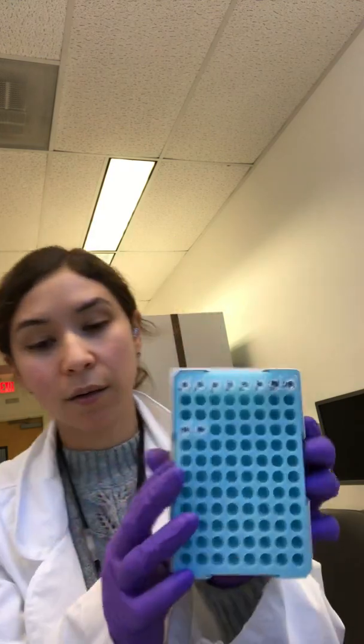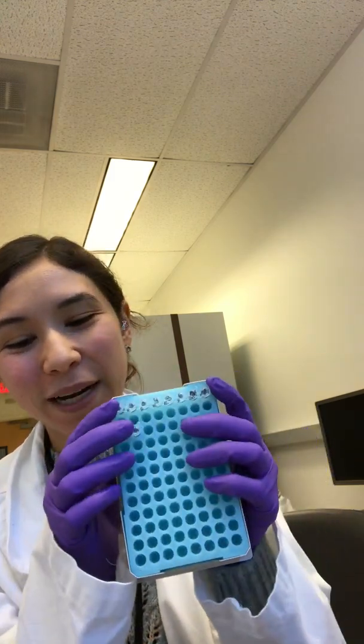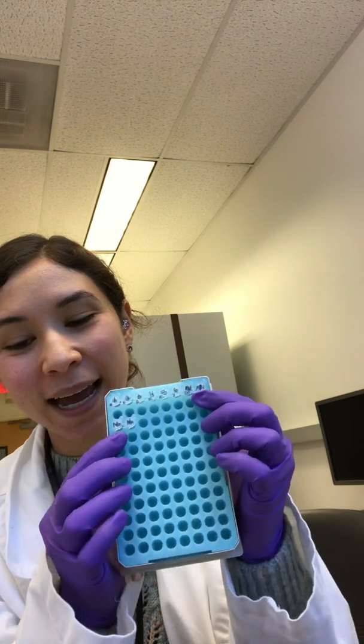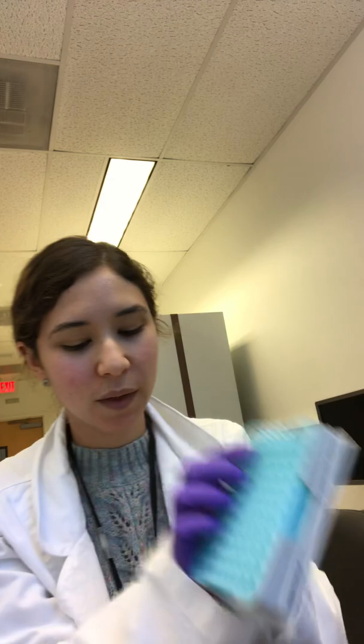Close all your tubes nice and securely. We're going to write down what this is. So NPCR plus the date. Just FYI, you shouldn't hold things like this. I'm just doing it for the camera. And the right numbers. So here's NI, NI, NN, NN. So there's our 4 negatives because this is our nested PCR.